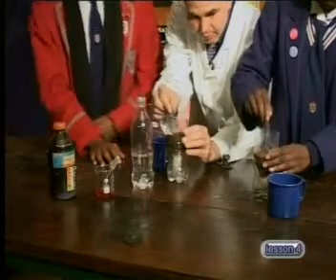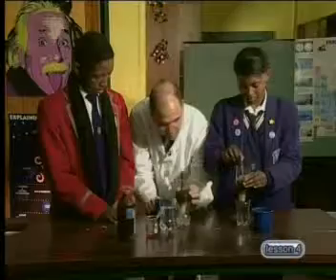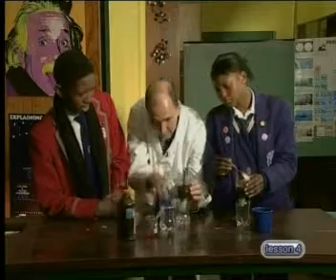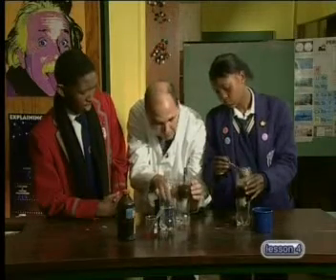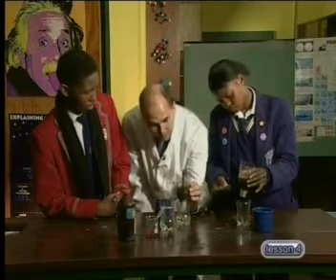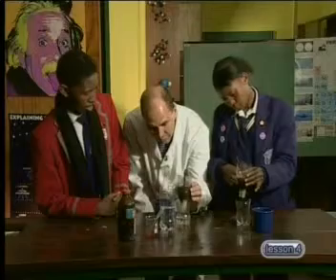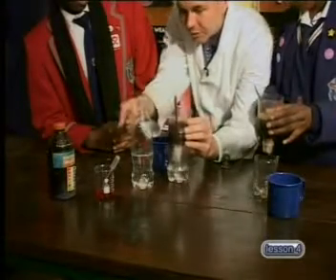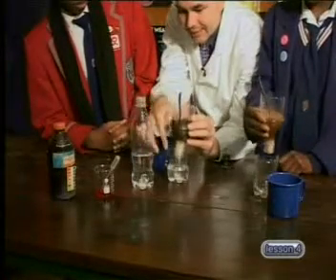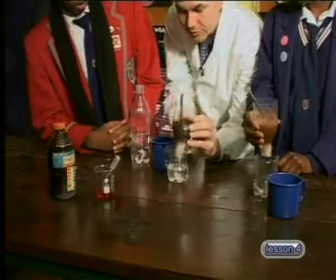Pick up the outer bottle. It's dripping through nicely. The water is looking quite clean because of the tissue paper that's acting as a filter — it's stopping any of the muck getting through but giving us the drainage water. Now what we want to do is use some of that universal indicator, take a few drops, and add it to this runoff water. Why don't you do that now, Keke?